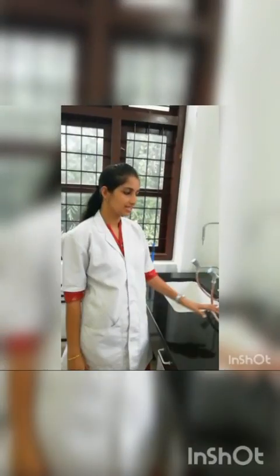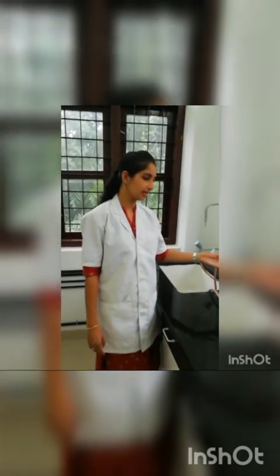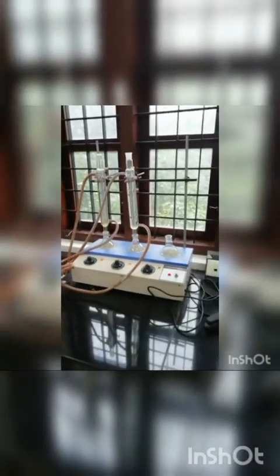The next step is we have to condense both of the solutions. So in order to condense our sample, I have transferred the test sample and the blank to the RB flask. You can see this. This is the blank and this is the test sample. And this is the reflux condenser. As you can see, this is the equipment, and it is already connected, and I have started the condensation process.